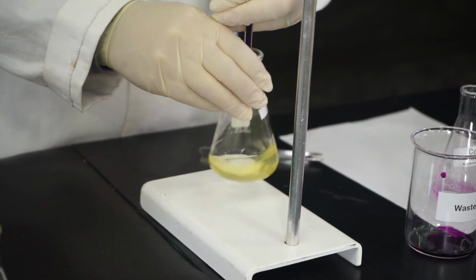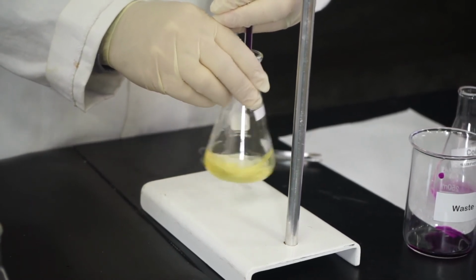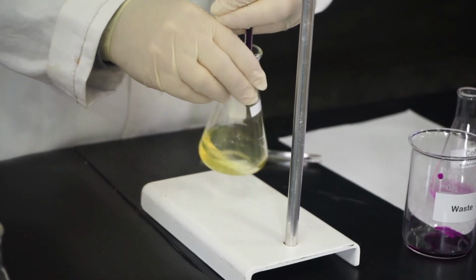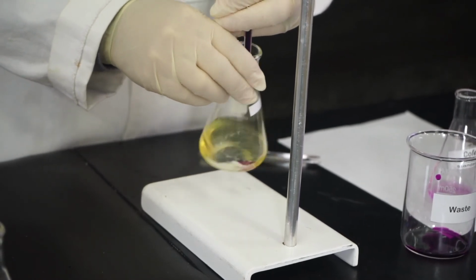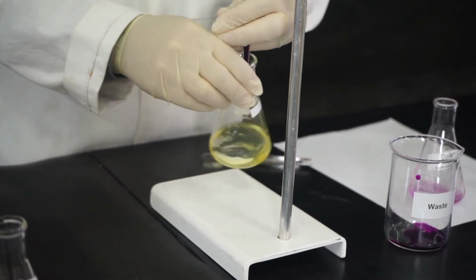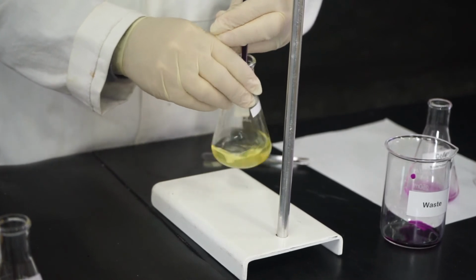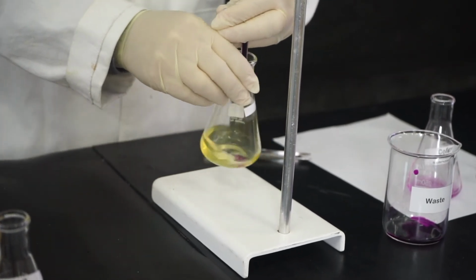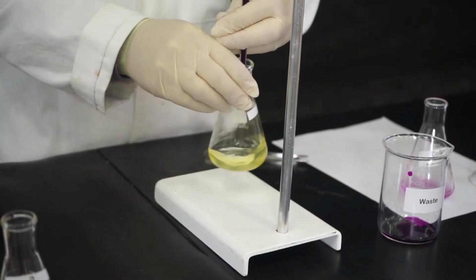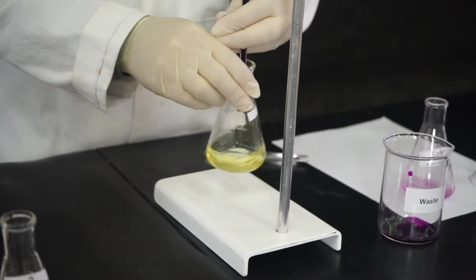We have to have patience. This does take some time, and we don't want to pass the endpoint. So if you're a good analytical chemist, you have patience. You can be faster in your second and third trial, because then you would know around what volume your color would change. But because this is my first trial, I don't know that yet. So I guess I have to do it very slowly.